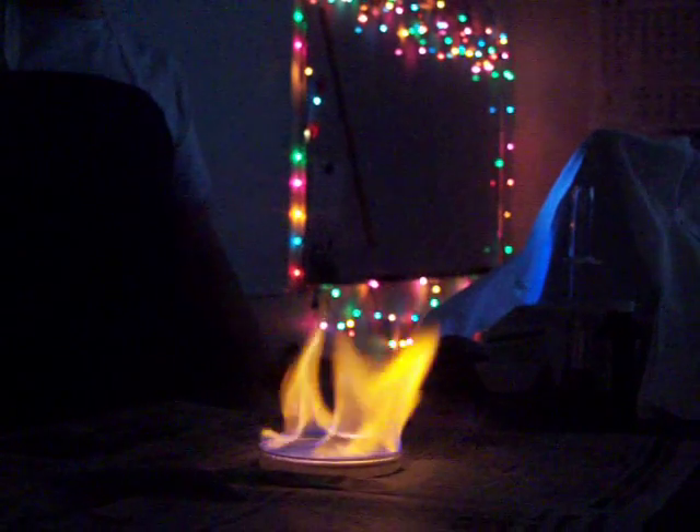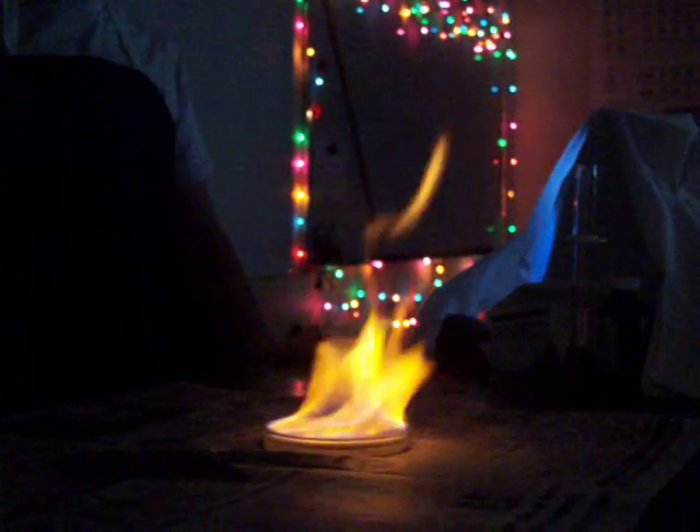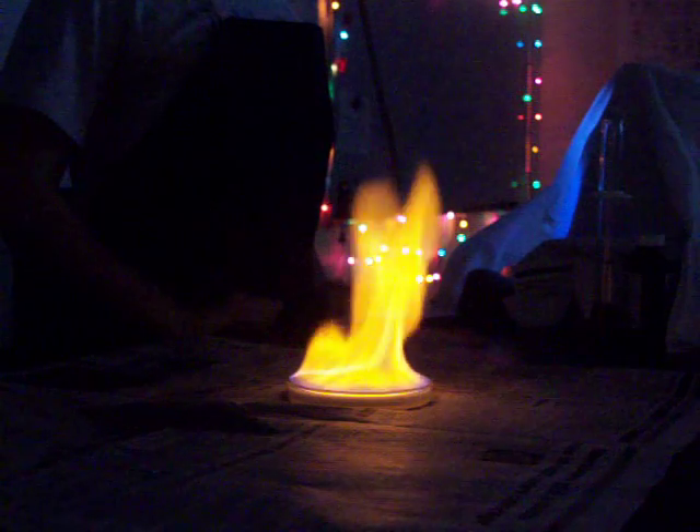So this was the 6%, and that's what it did. What is that stuff you add to it? Potassium permanganate. It's on the paper — it's a big P word. It's like sparkling right now.